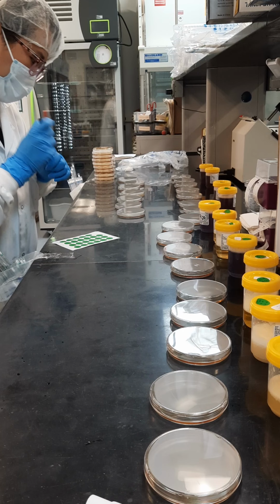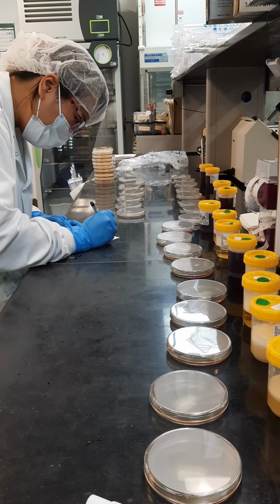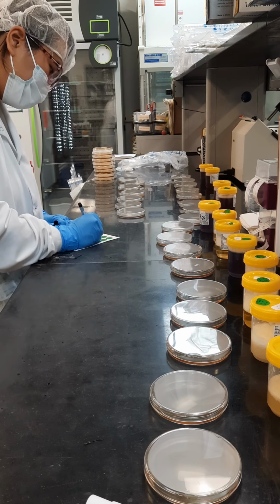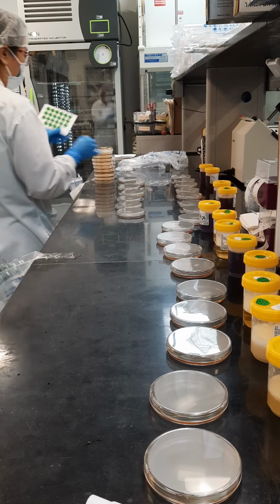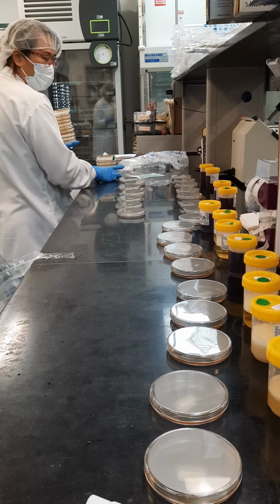As a reminder, for whoever does plate reads, which is also probably me or my one coworker, sign these initials. It's what's called liability, to know who did what tests in case anything happens in the midst of the testing. We could count back if anything unusual happens, for out-of-spec investigations.